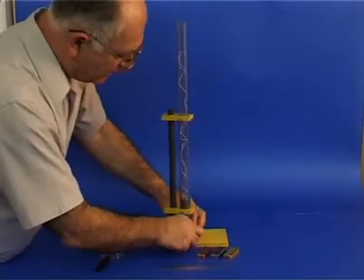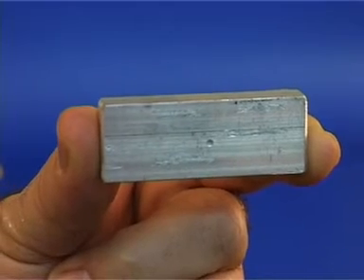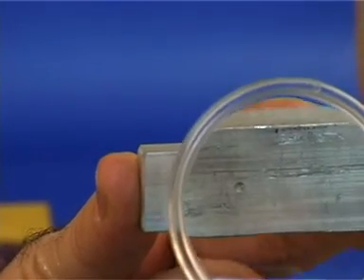Remove the metal, examine and measure the size and depth of the imprint using the magnifying glass and the ruler.